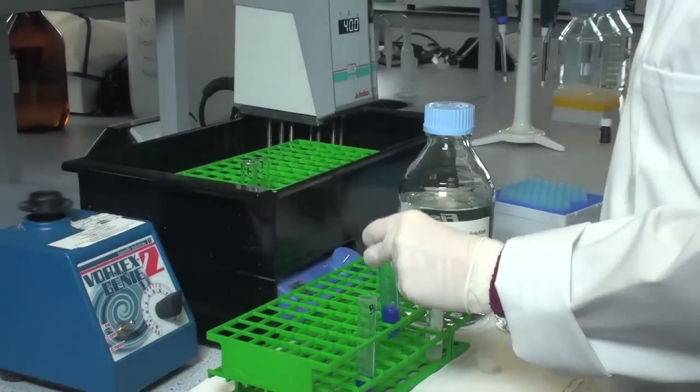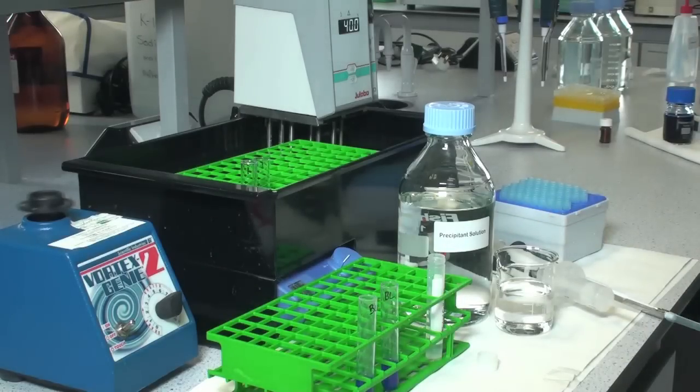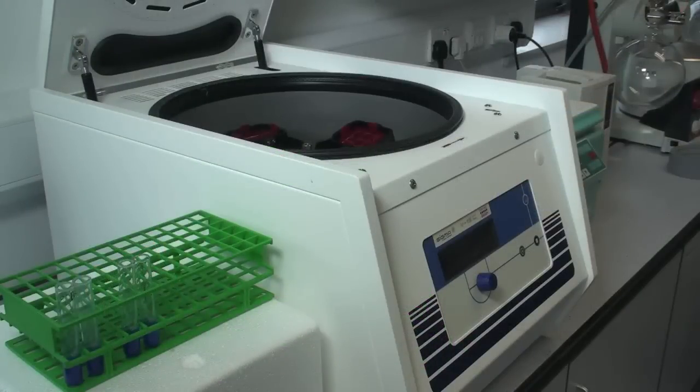It is very important to stir the tubes very vigorously as shown in this scene. Allow the reaction tube to equilibrate to room temperature for 10 minutes.